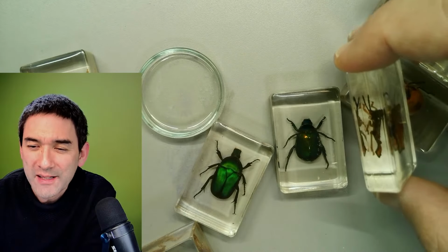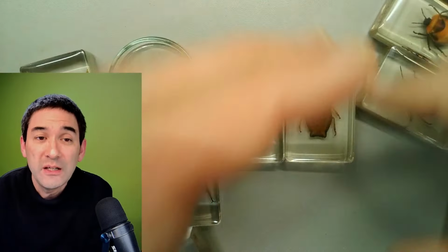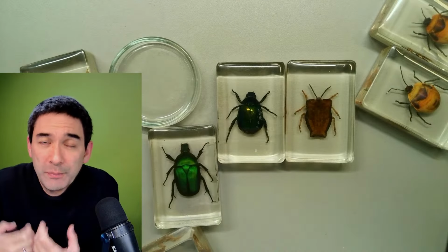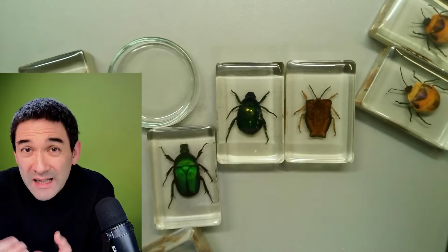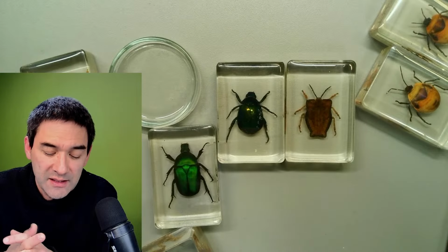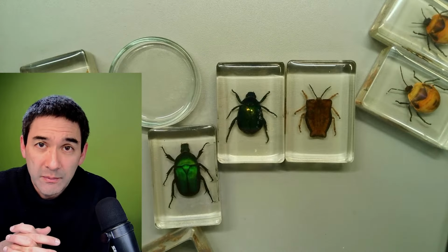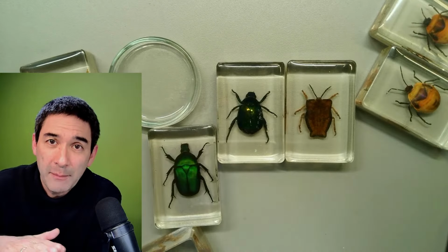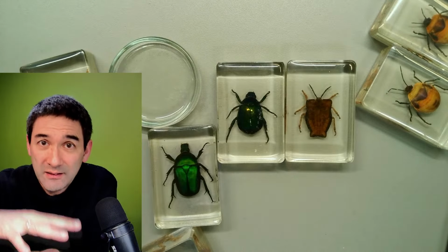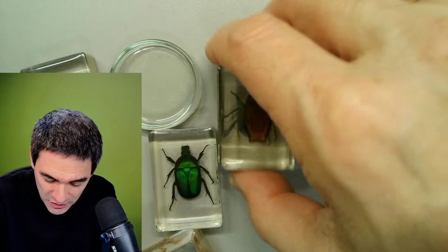Yeah, never put anything wet inside a resin block. They can explode. Ask me how I know. Okay, because of the decomposition gases that the bacteria form, right? And then the pressure builds up, with methane gas maybe, because it's anaerobic, and then it blows up. As a matter of fact, you have these things not only in here but also in improperly prepared microscope slides. If they're not properly prepared, this can blow off and remove the cover glass because the bubbles are expanding and push everything apart. That's just something I want to share with you as well.